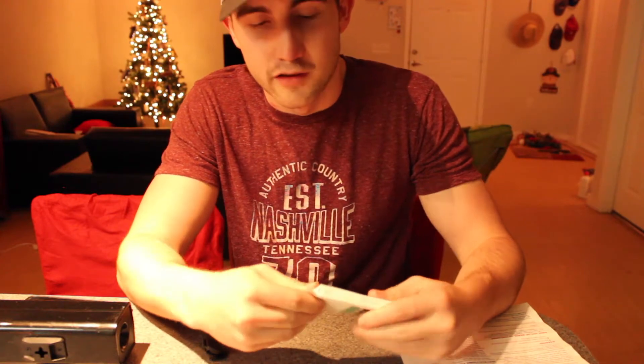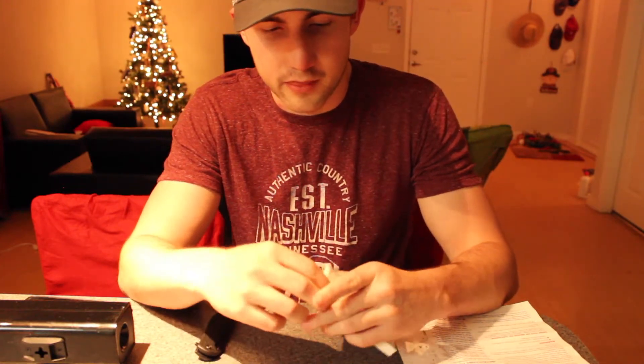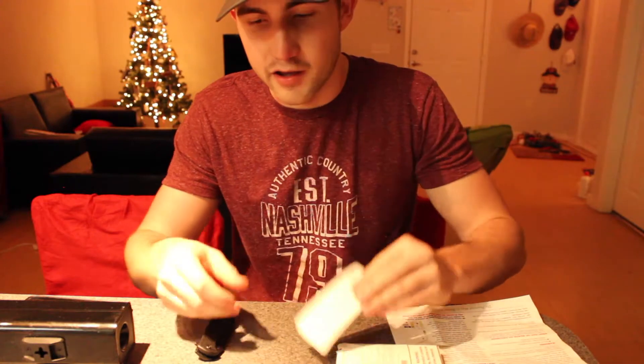Question I think we all want to know. So I got a fresh pack of Juul pods, just bought them at the store so you know it's real. Go ahead and open it up. Full pack.